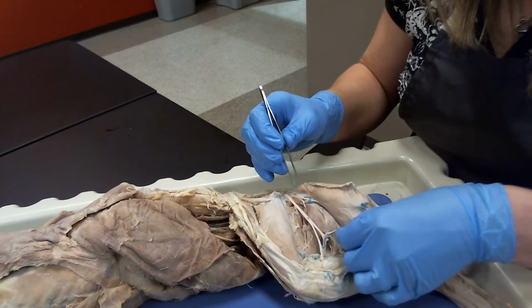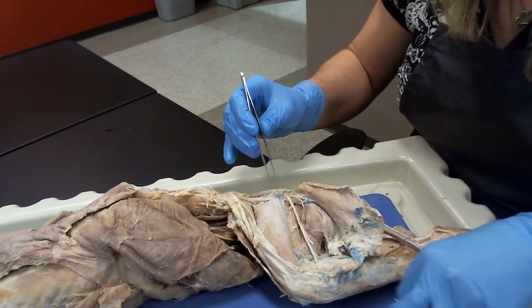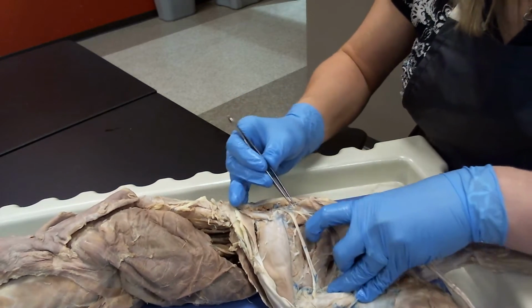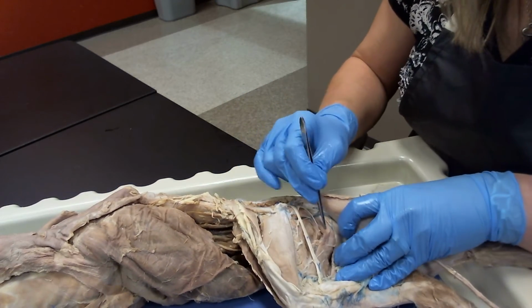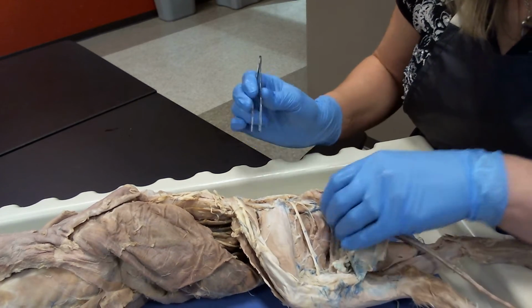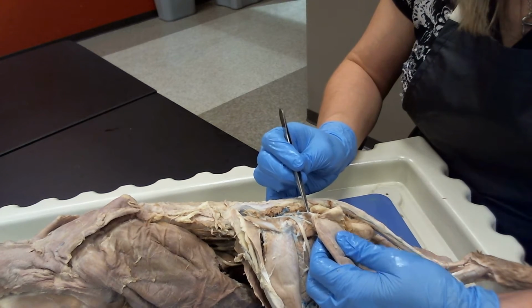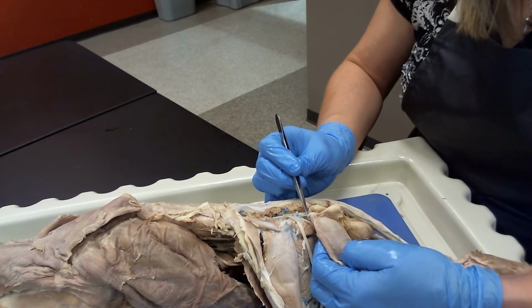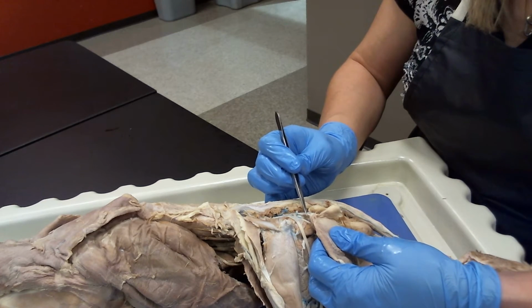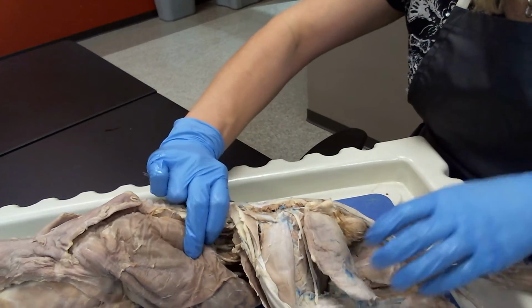All right, so now moving on down, you'll watch the branch coming off up here proximally off of your ischiatic or your sciatic. These are your muscular branches, okay? And then if we flip it over right here and we look, this branch coming off right here and diving into your biceps femoris muscle is your posterior femoral cutaneous nerve.